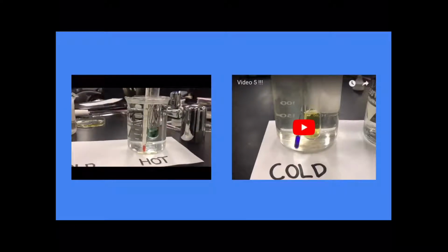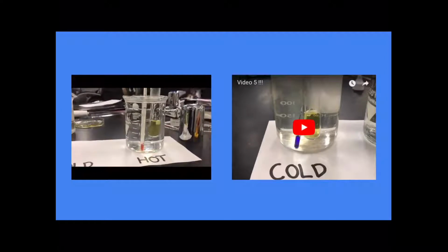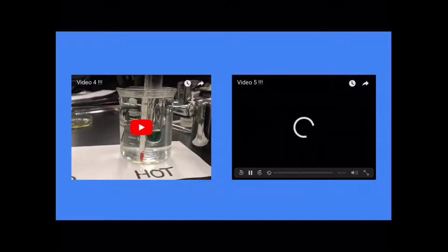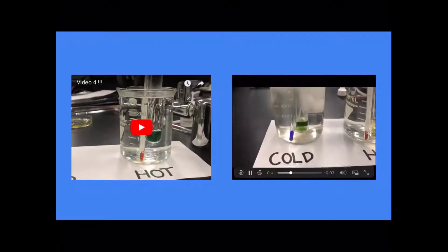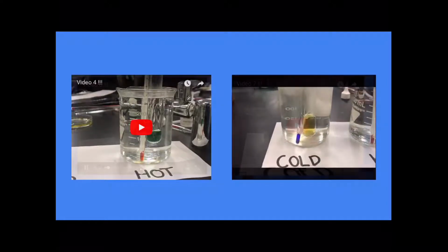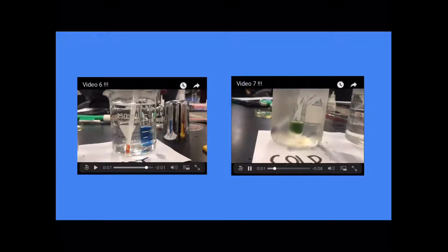To test the effect of temperature, in these videos we add HCl to the bromothymol blue solution in a hot beaker of water and a cold beaker of water and test the differences. The same test is made for temperature when we add NaOH to the bromothymol blue in hot and the bromothymol blue in cold.